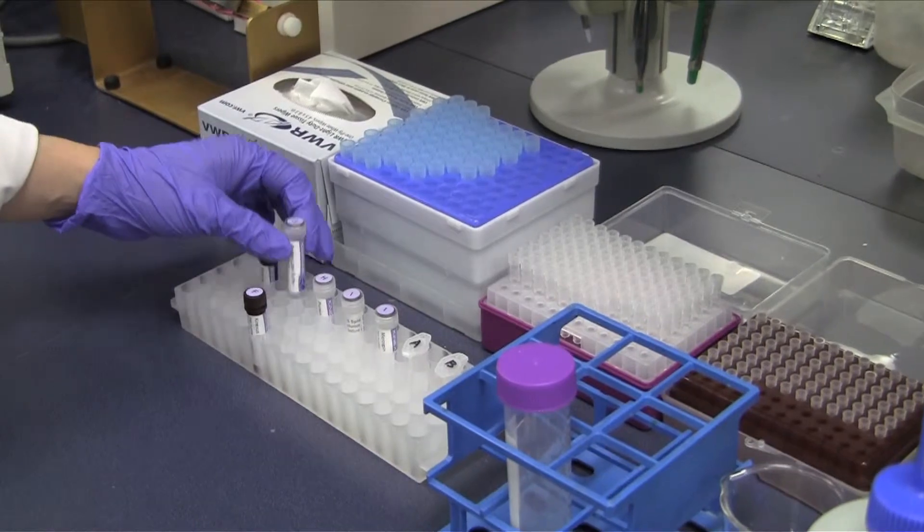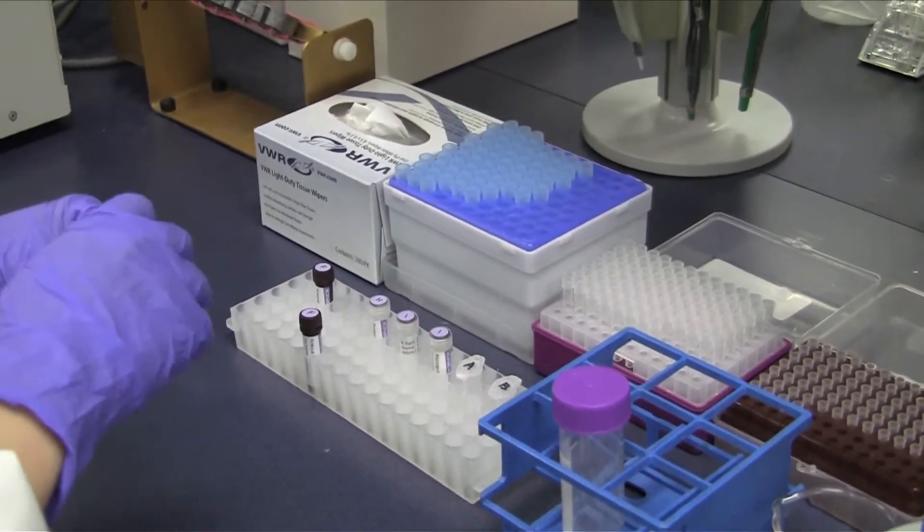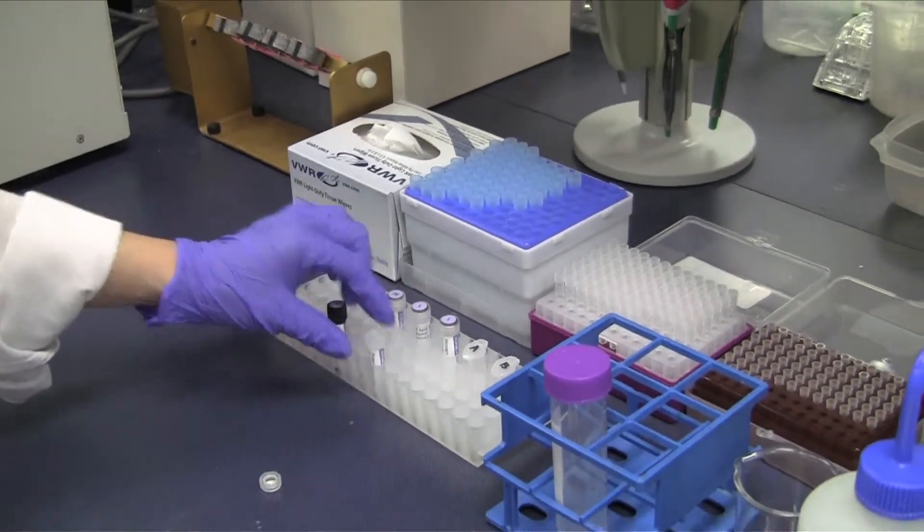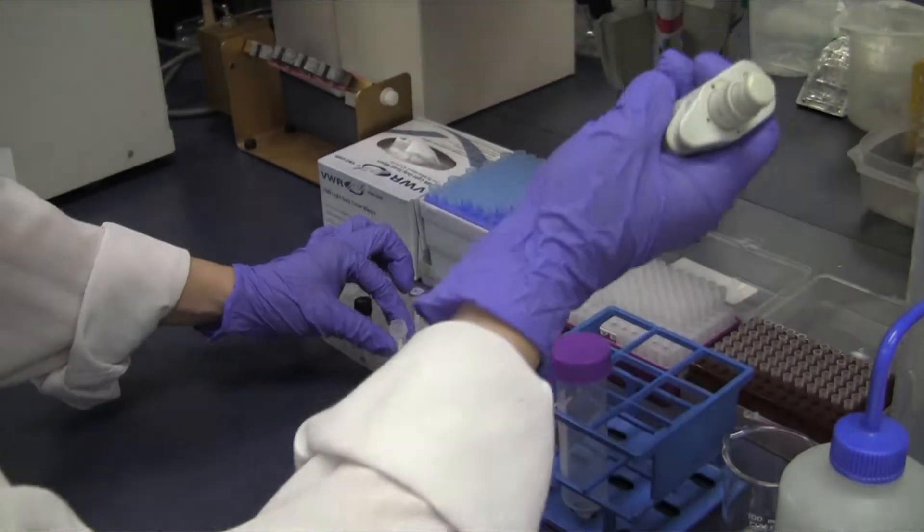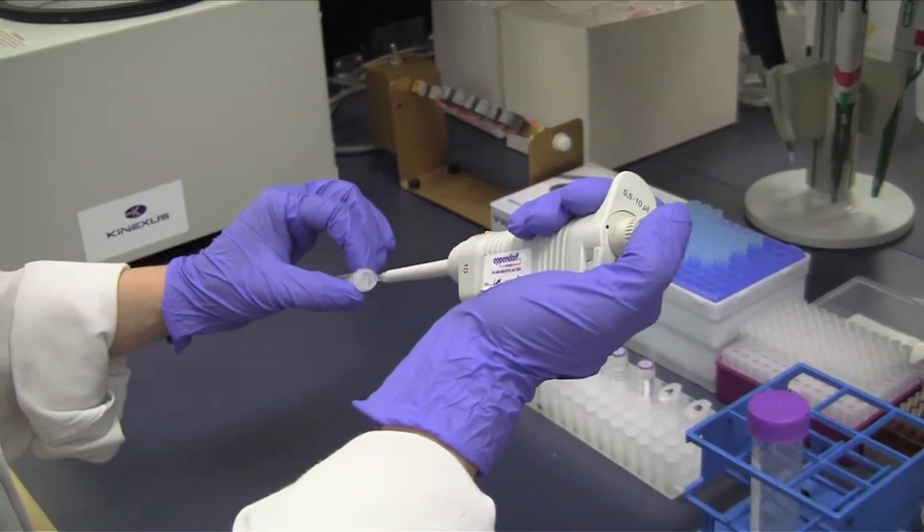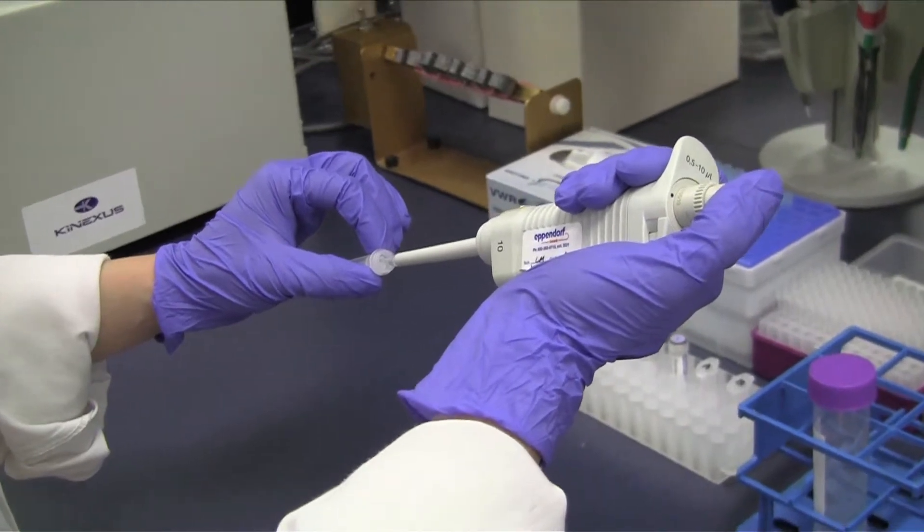Add 2.5 microliters of protein labeling buffer 1 part CAMG and top up the total volume to 30 microliters with protein labeling buffer 2 part CAMH.